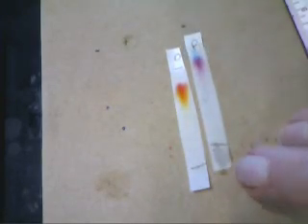As we take each of the strips out of the test tubes, we have to lay them down and mark with our pencil how far the solvent actually got. That's because that's the total distance we compare against how far the dots moved when we're trying to get our RF values.